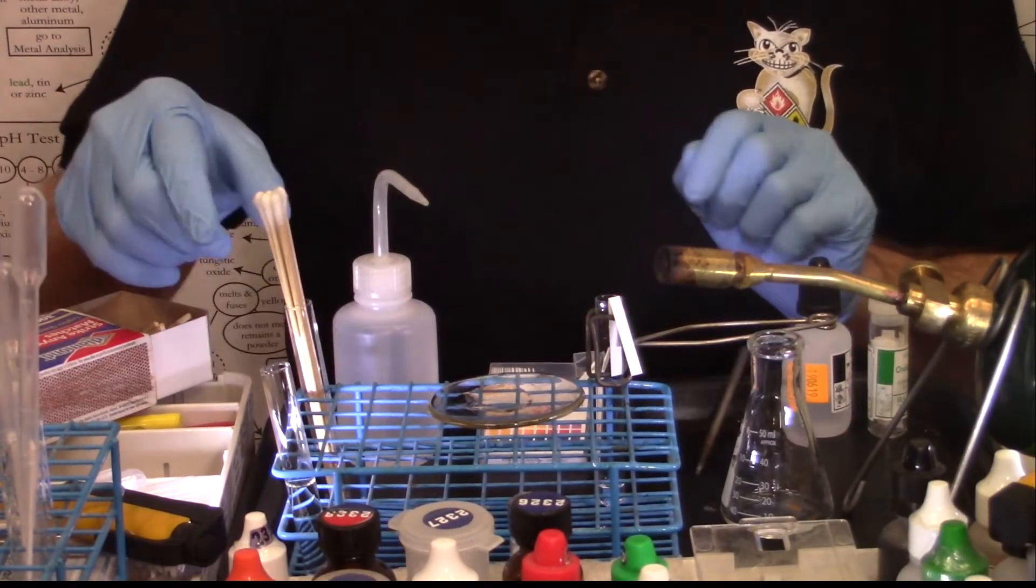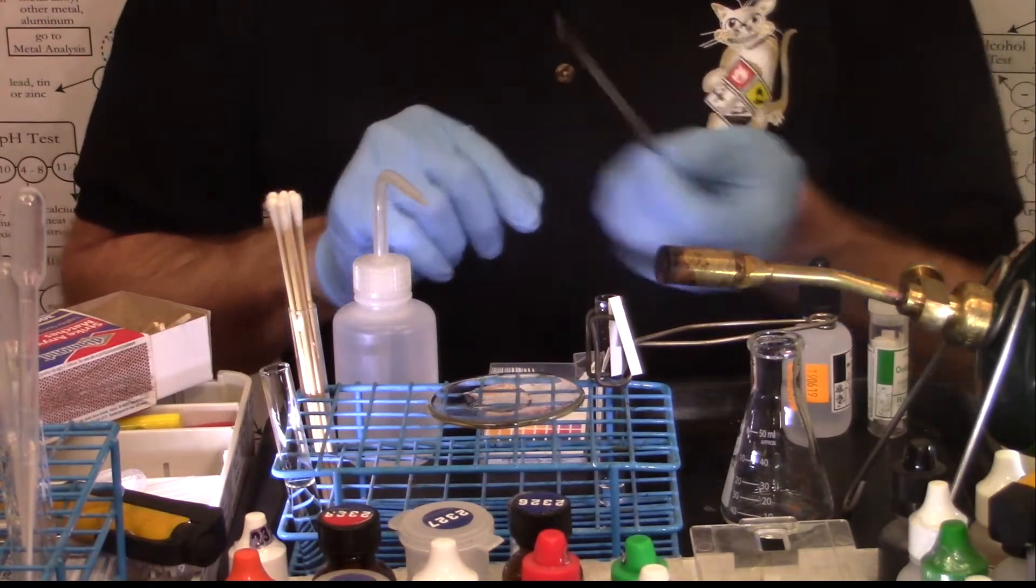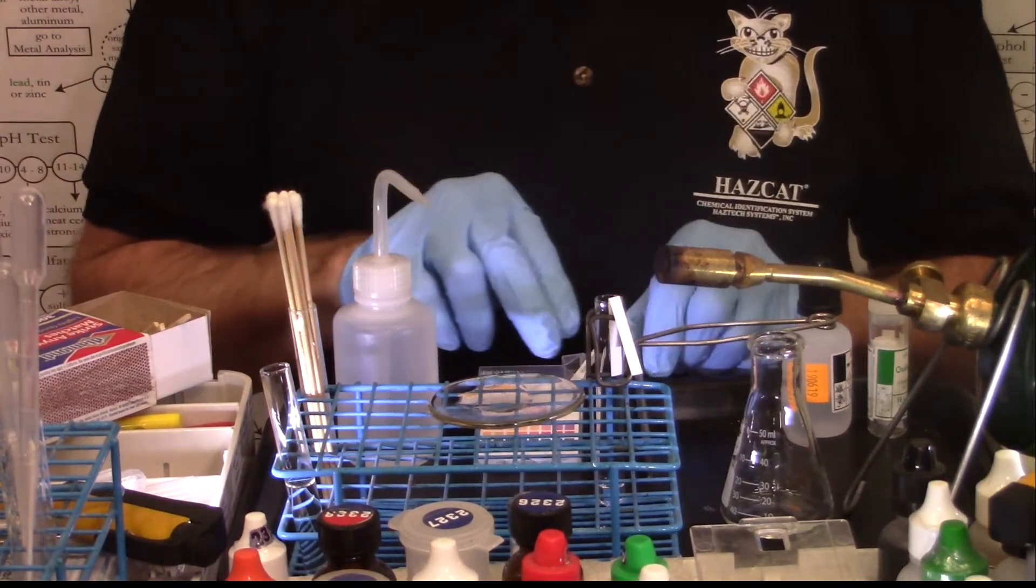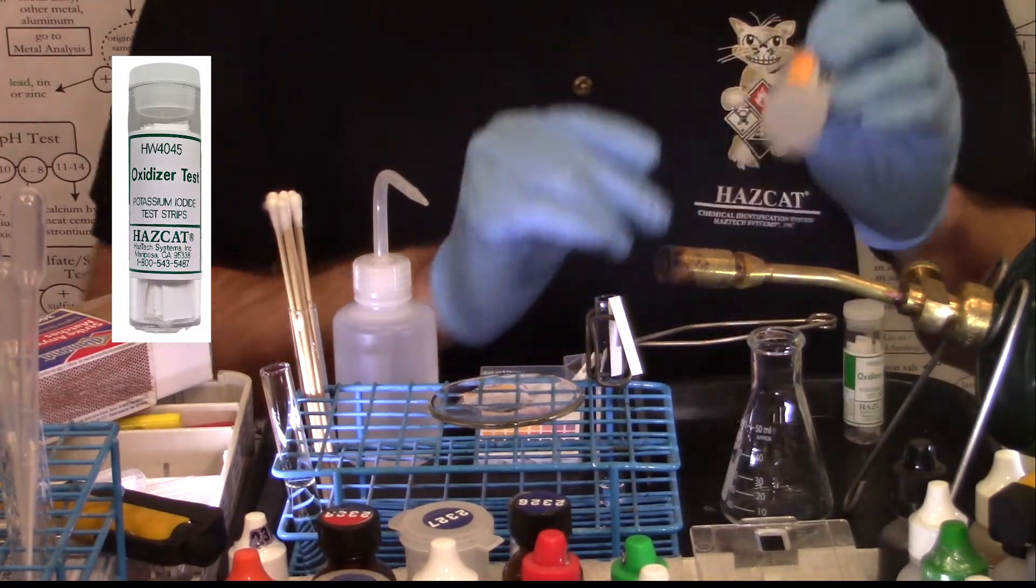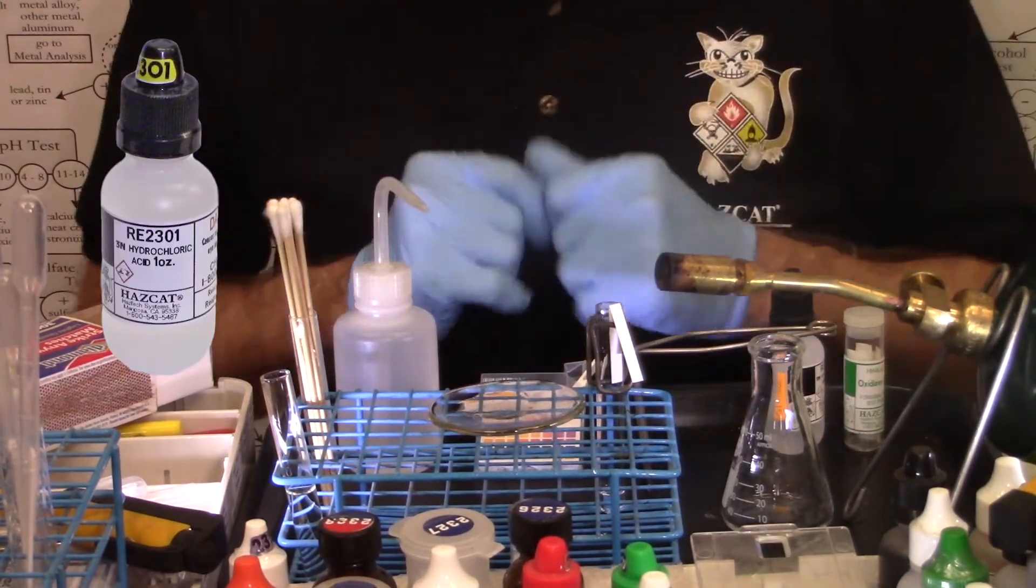The other tools I need are cotton swabs, my thermal explosives tool, I'll need my Erlenmeyer flask, I'll need oxidizer test paper and three normal hydrochloric acid.